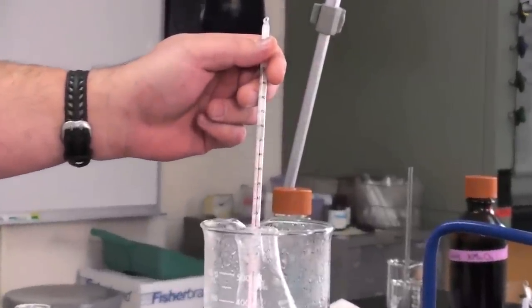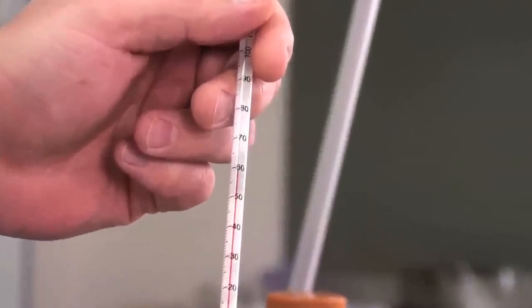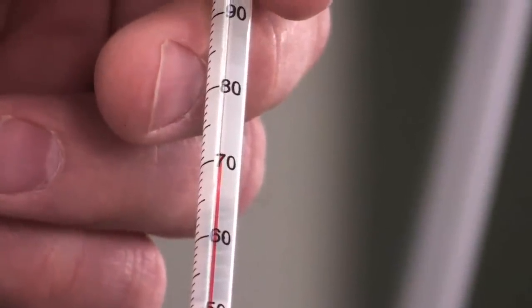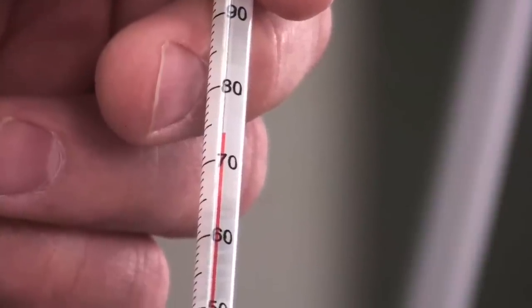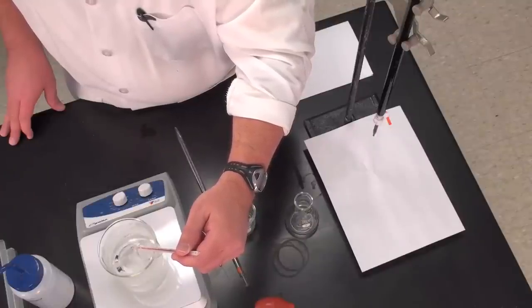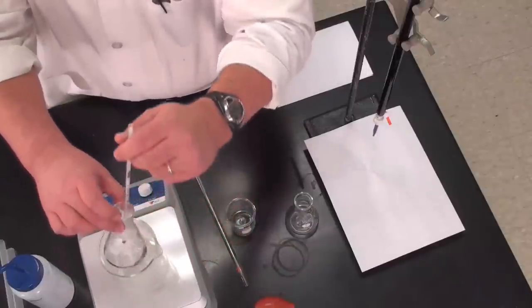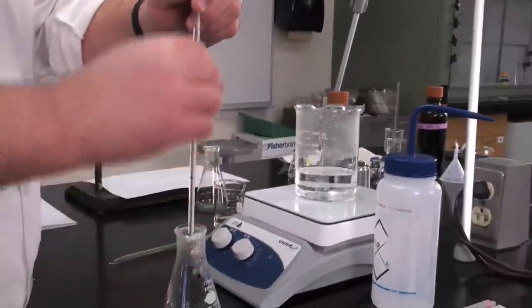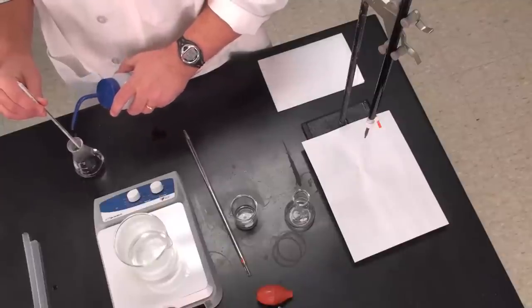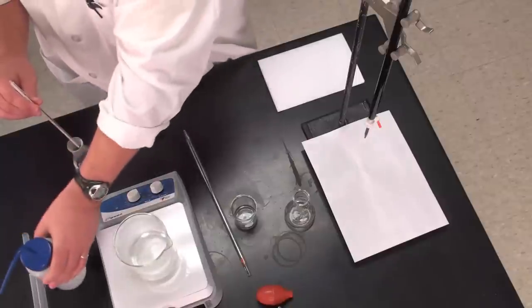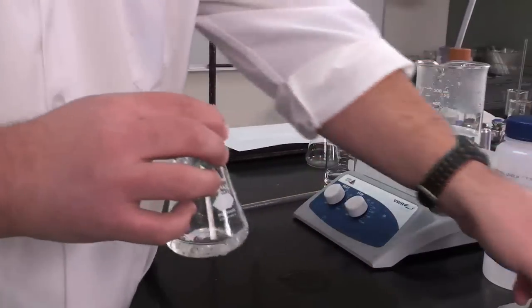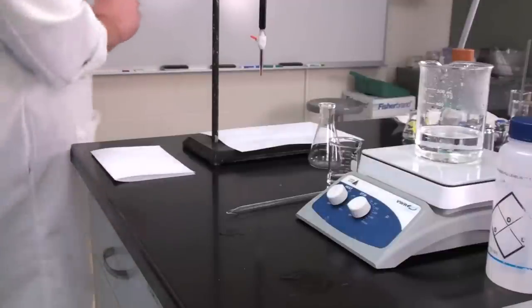Stick the thermometer right in there. It's warming up—that's a good sign. We are getting up above 75 degrees, pretty close to 80, so I think that'll be just fine. Let's take our oxalate solution out of the water bath. The thermometer has a few drops of our oxalate on it—we don't want to lose those because we've already measured them out precisely. So I'm just going to run a little water in there to wash those off. I'm going to use as little water as possible because every bit of water at room temperature lowers the temperature of my solution.